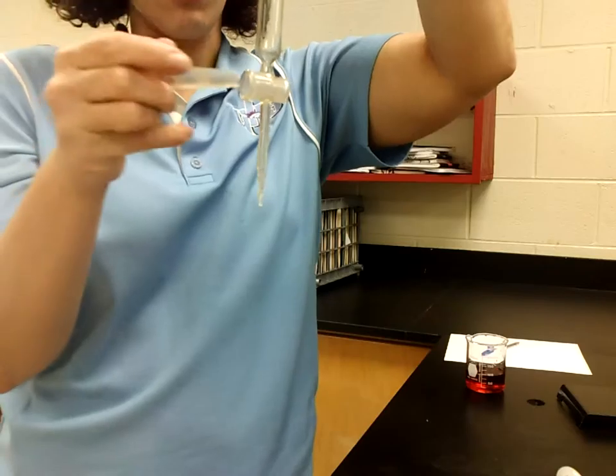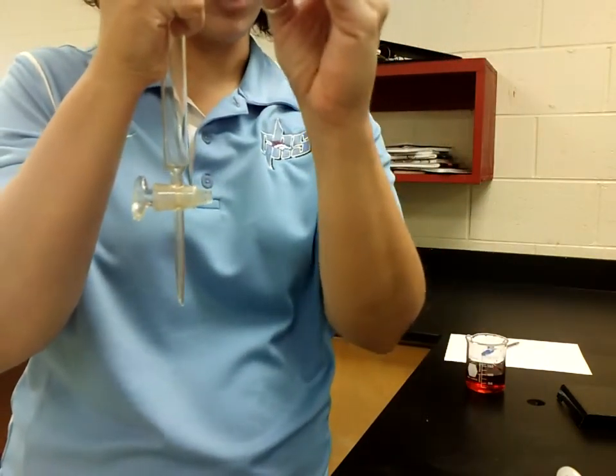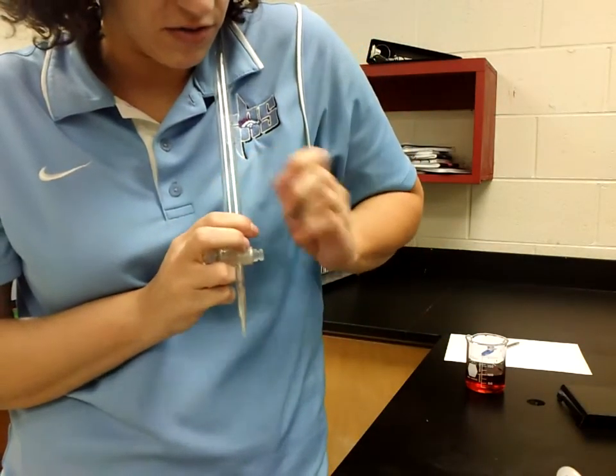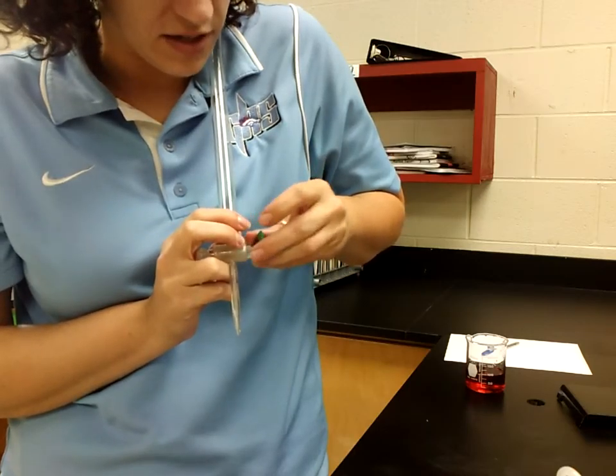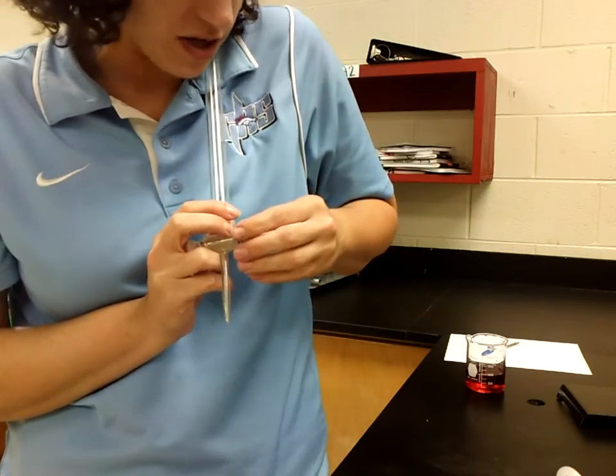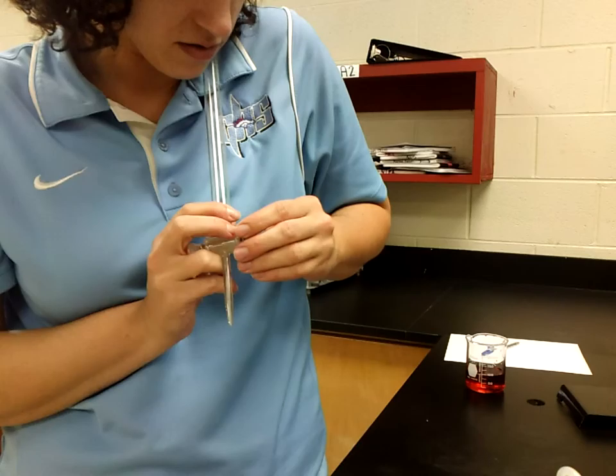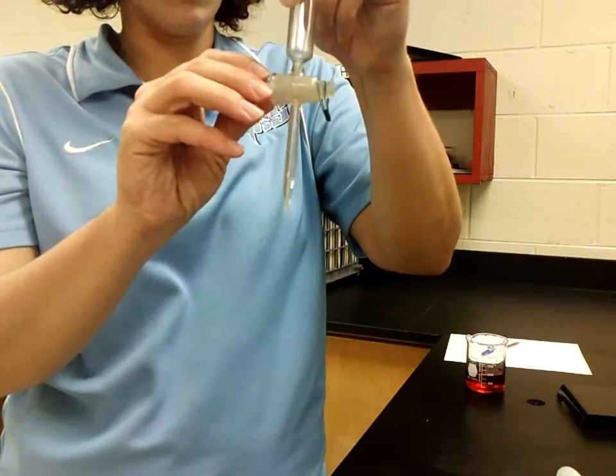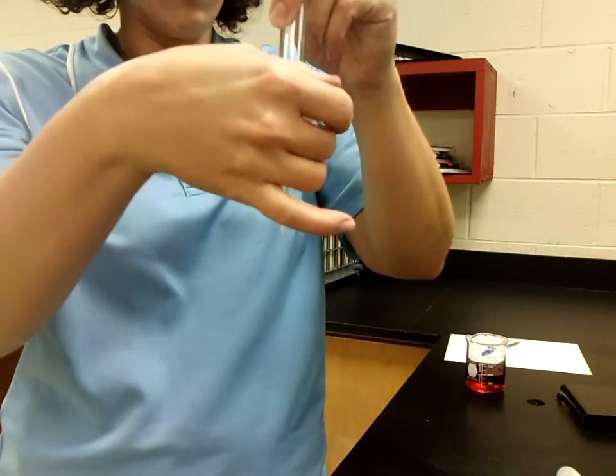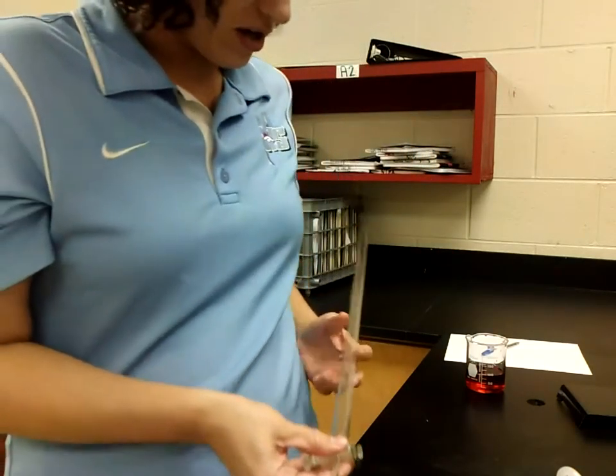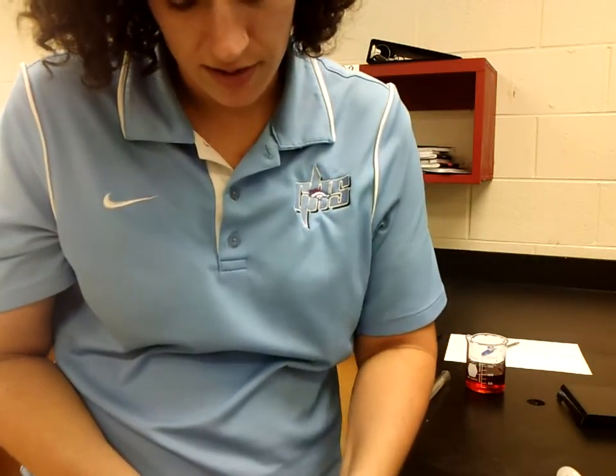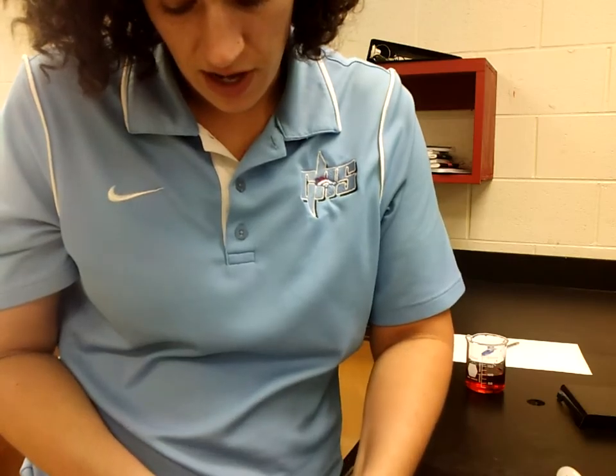To keep this anchored in here so it doesn't slide out, most of the ones that I'm going to have you use will also have a clip with them, and this clip goes on the very end. They can be very hard to do, so you and your partner might need to tag team this. This clip goes on the end. Just to make sure that once it's on, it can't be pulled out. So please make sure once again this clip gets on there. Otherwise, you're going to have a leaky, disgusting mess as you guys are doing this lab.